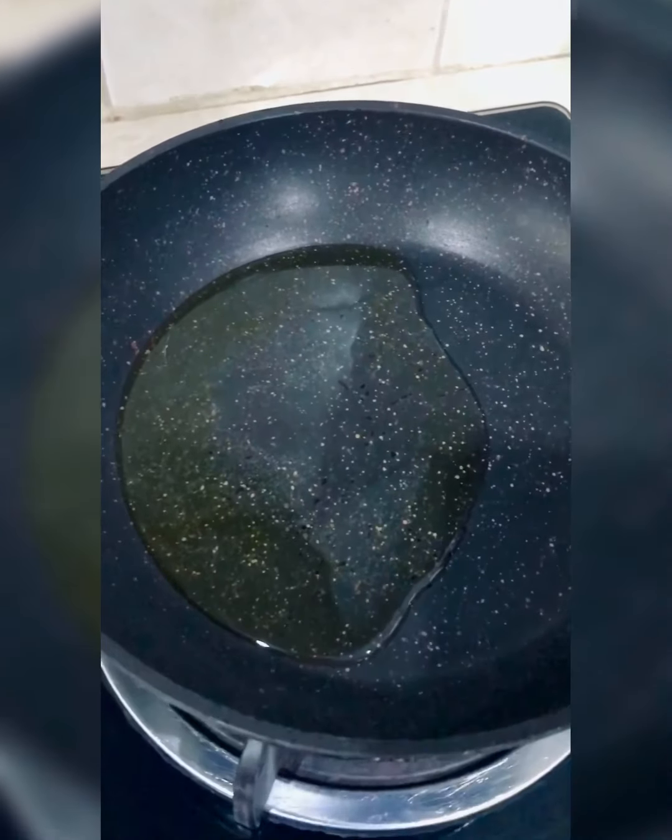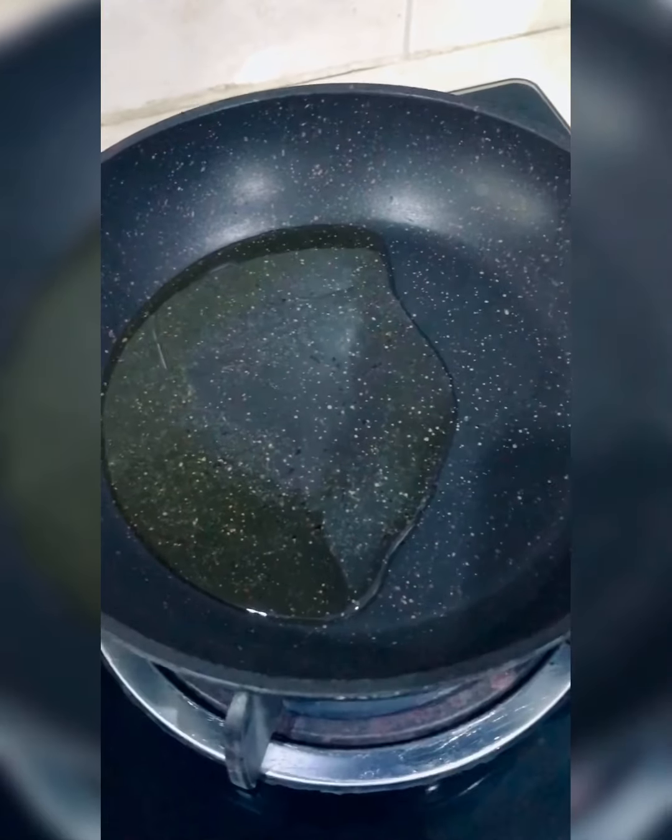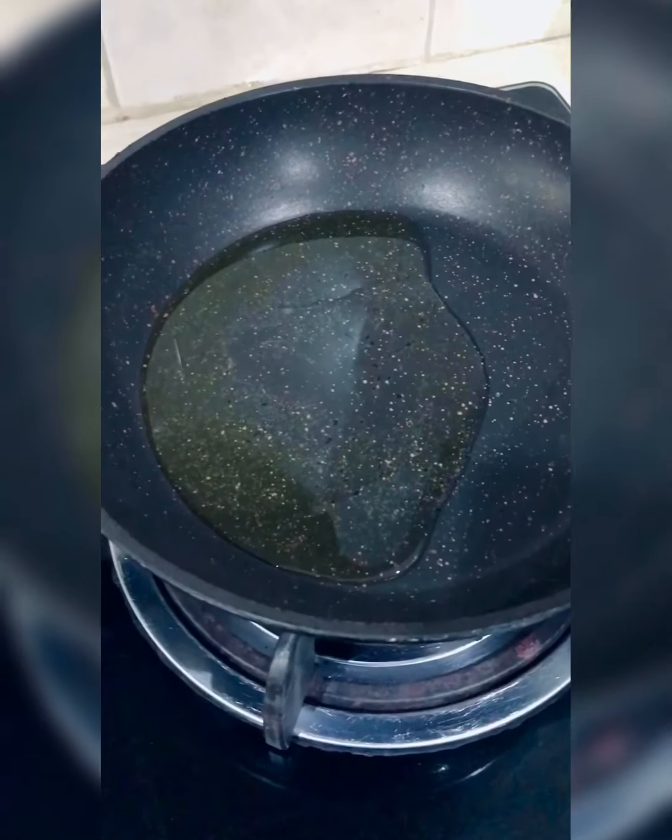Later, stir and wait for 15 minutes. So after 15 minutes, cool the blended oil and proceed with the cloud point analysis, which one of my group members will continue. Thank you.